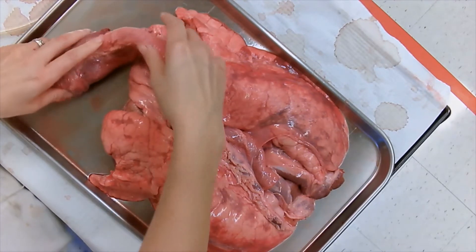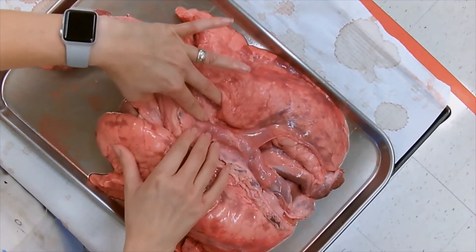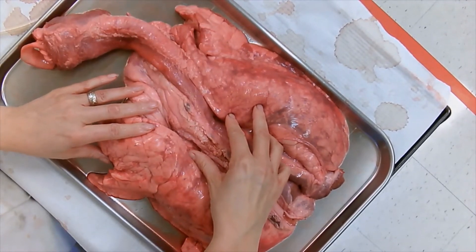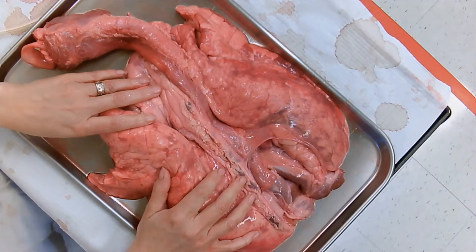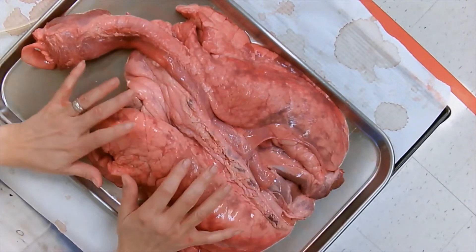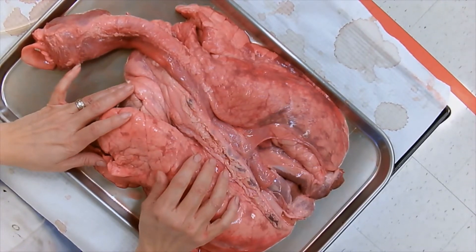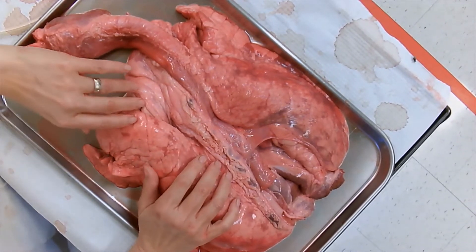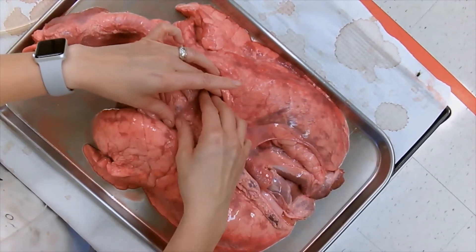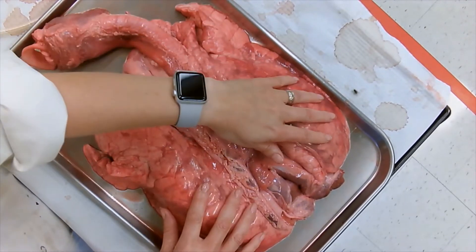The trachea goes all the way down and breaks into two parts. This is the bronchi — it splits into two parts and goes all through the lungs.